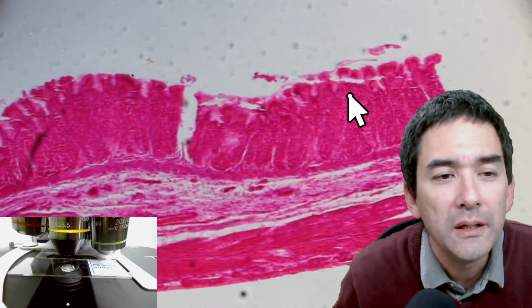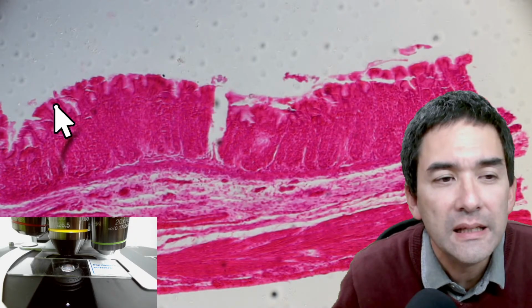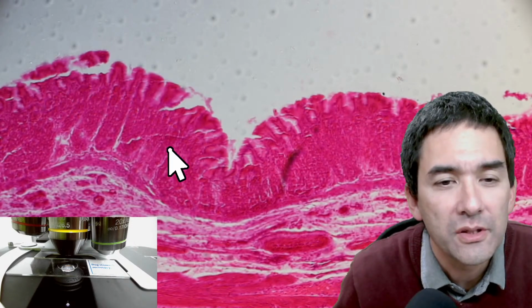Layers. Could be that, again, this here is the inside where you see that the surface area is very large. Yeah?